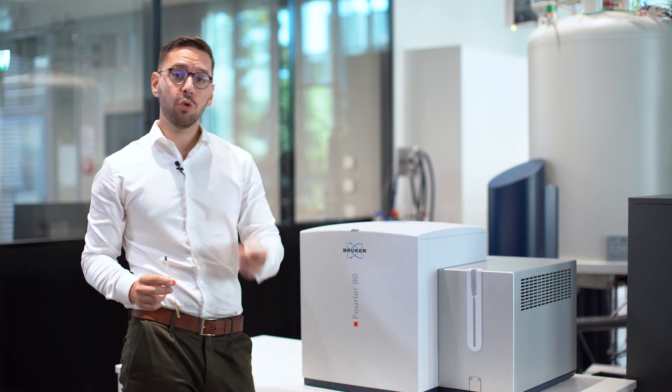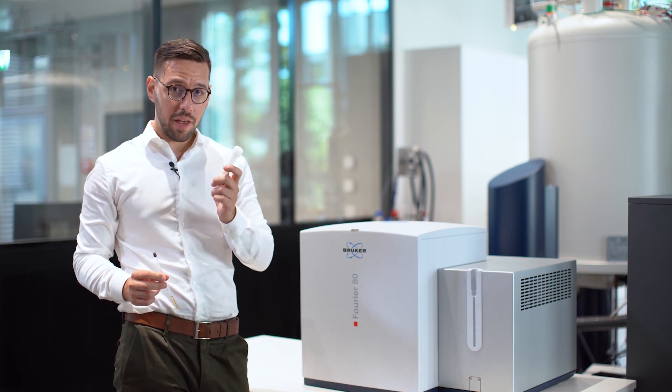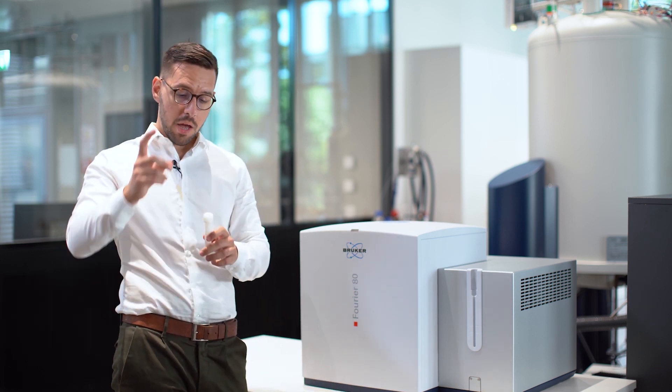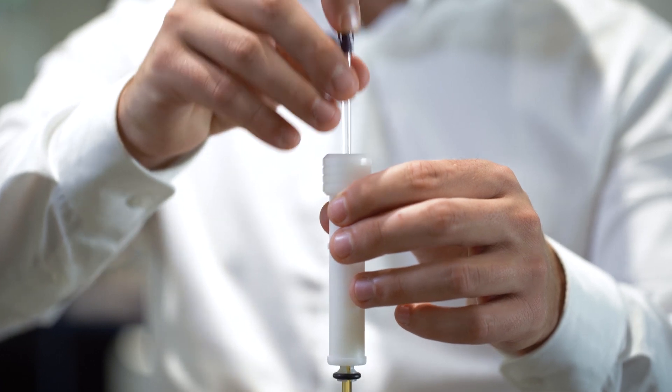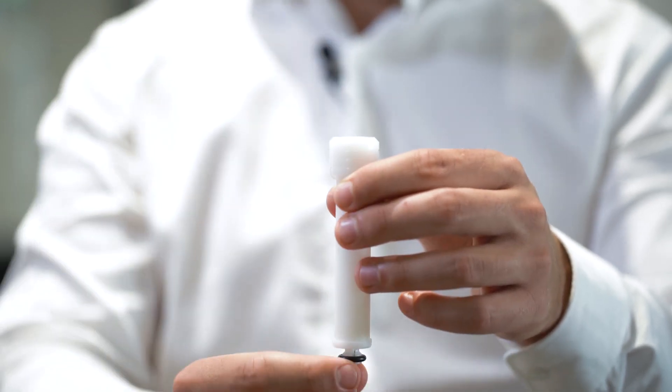Everything you need to do is to take your sample holder and push the sample all the way to the bottom of it.